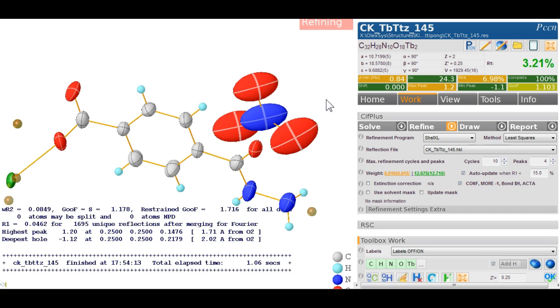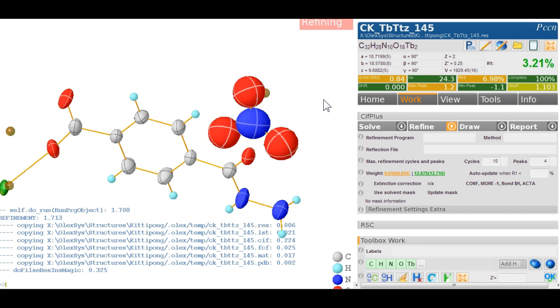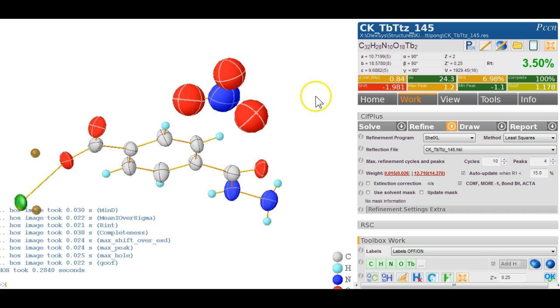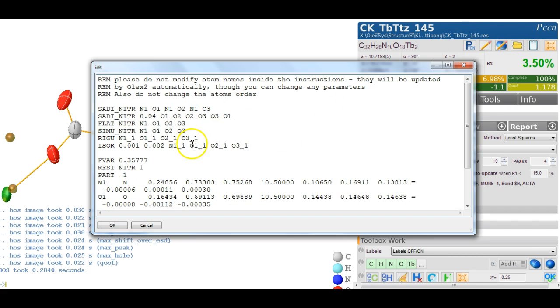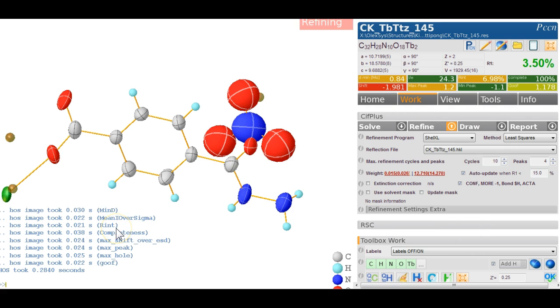The R factor is 3.21%. Everything looks good, 3.5%. Obviously this has gone up quite a bit. Let's just reduce this a little bit. We click on that, and I'm making the ISOR only 0.1, and take this one down here and hit refine again.